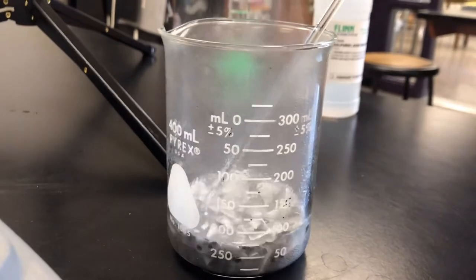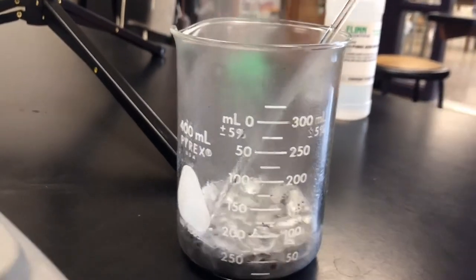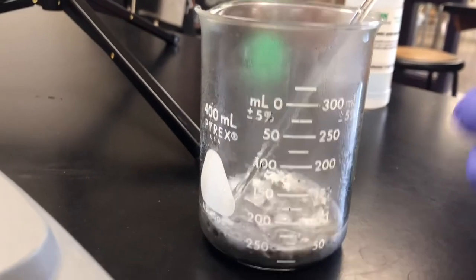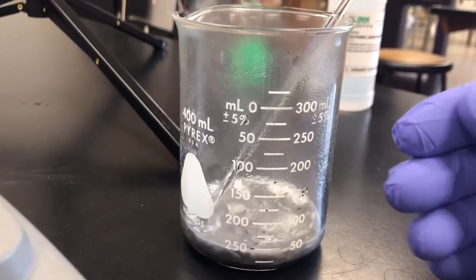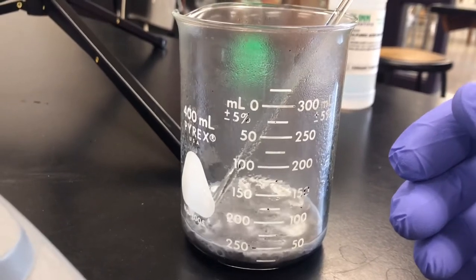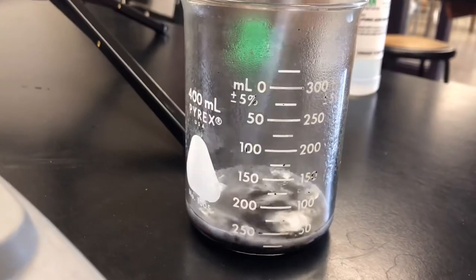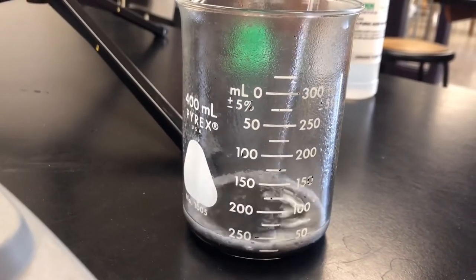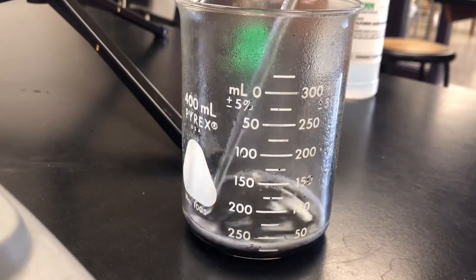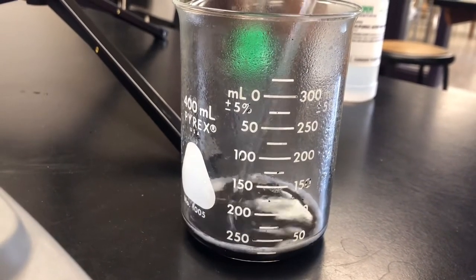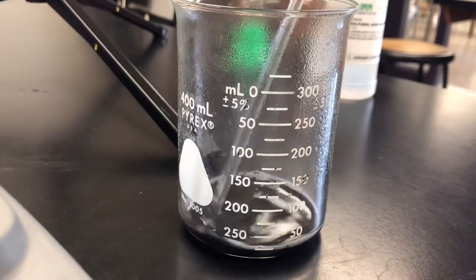That's why you would want to wear gloves, because if any of this is hot potassium hydroxide, that is going to recondense on your fingers. And hopefully we're going to get all of the aluminum dissolved. Hopefully the aluminum is the limiting reactant and it runs out first.